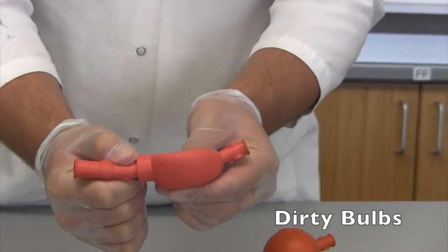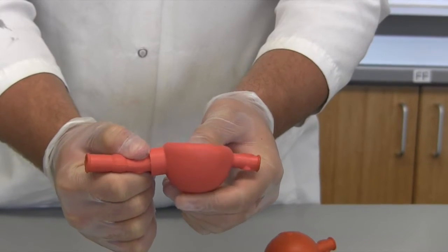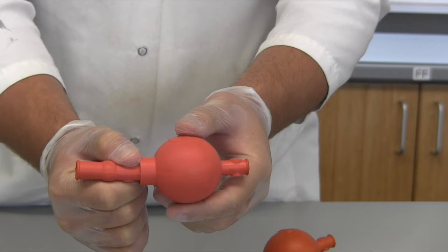You should always make sure to pull up your liquid carefully so as not to suck any into the bulb, which will contaminate it and damage it for the next person. This is what one sounds like. If you find any of these, tell your professor and get a new one.